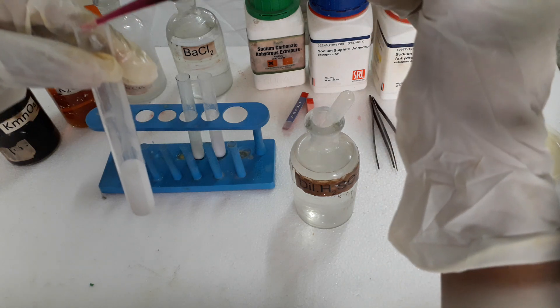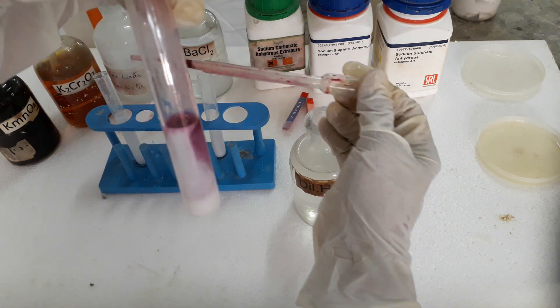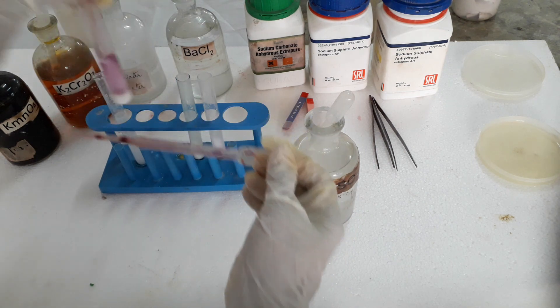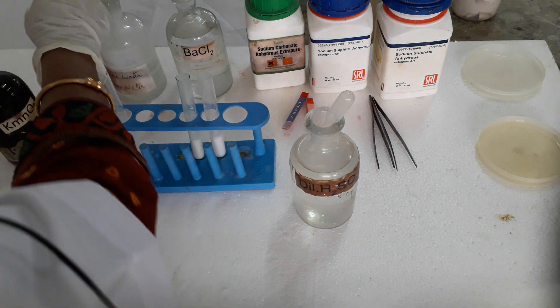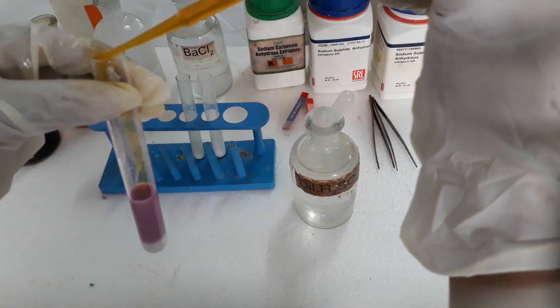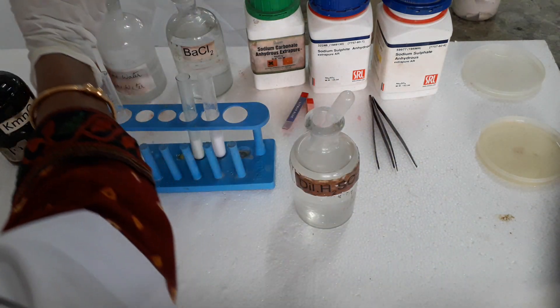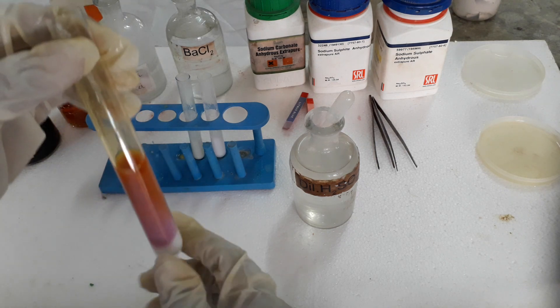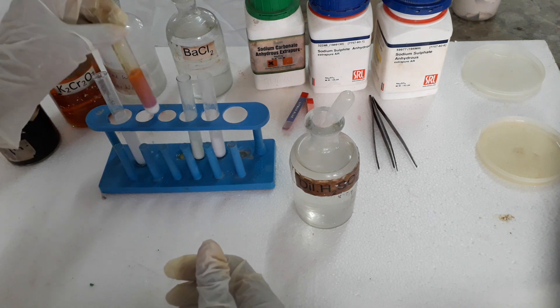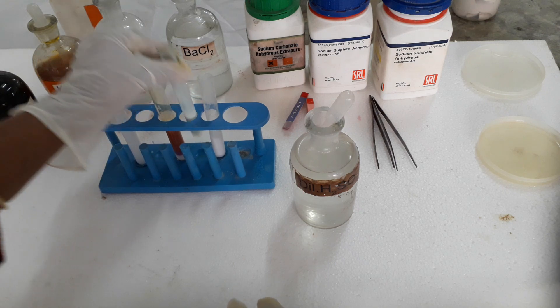A second test for carbon dioxide gas: pink potassium permanganate remains pink — there is no effect on CO₂ gas; it will not react. Next, on adding orange potassium dichromate, it also has no effect — orange remains orange and pink remains pink. So it is confirmed that the gas is carbon dioxide, meaning the anion present in the salt is carbonate.